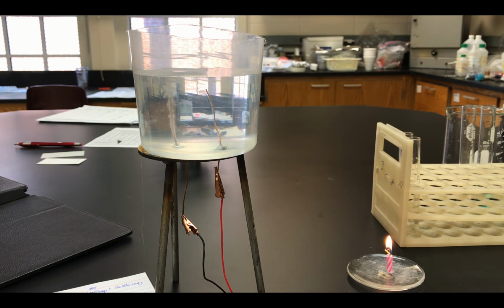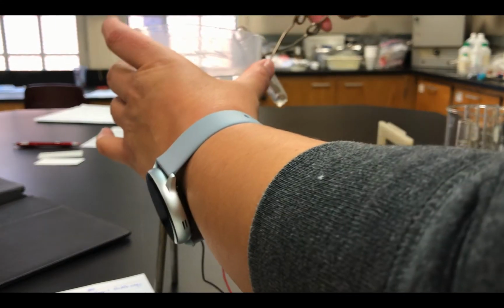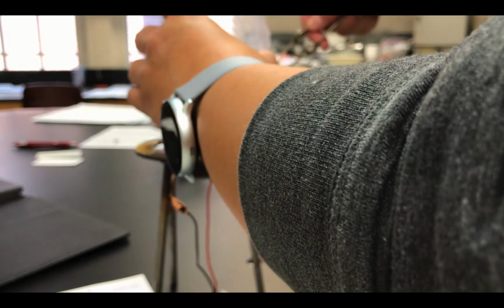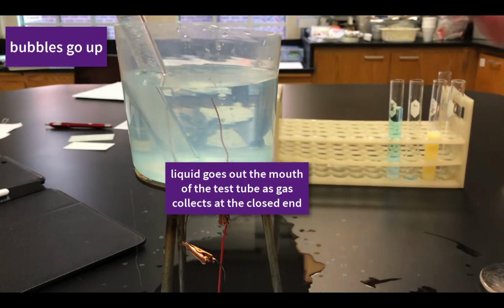And this is an example of one of the times where a reaction as written may not necessarily encompass all that is happening. Now we're going to take a test tube and we have to put some of that same solution in there so the electricity can continue to be conducted. So we'll fill it with a little bit of that solution. And you'll note when you look at the test tube, it is not full of the solution.